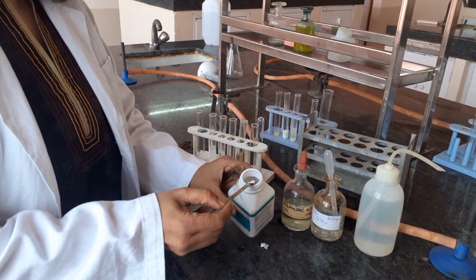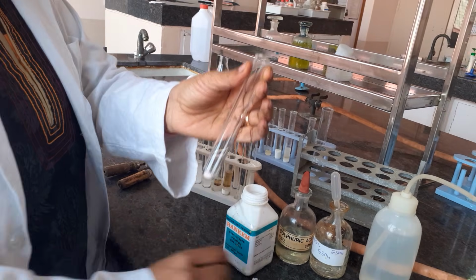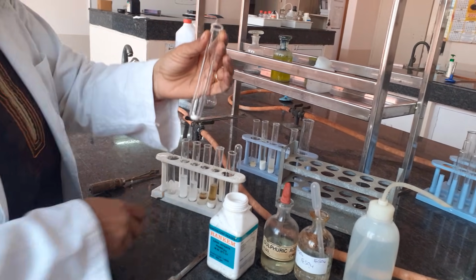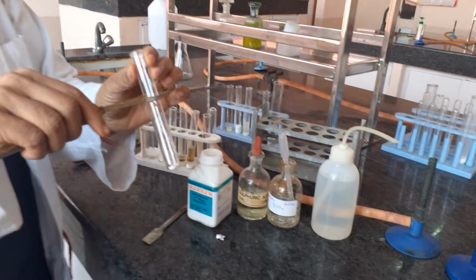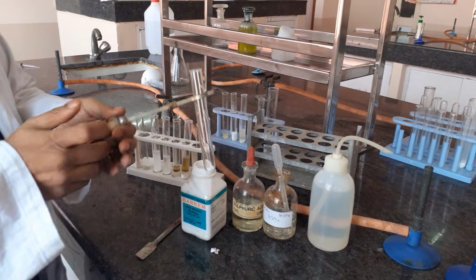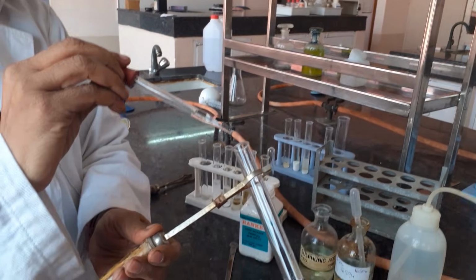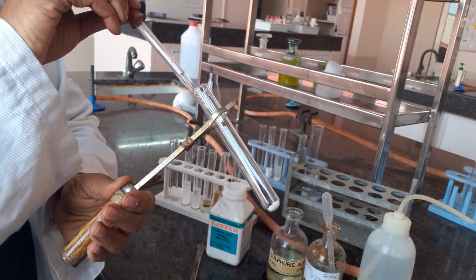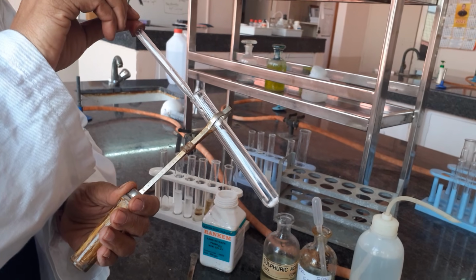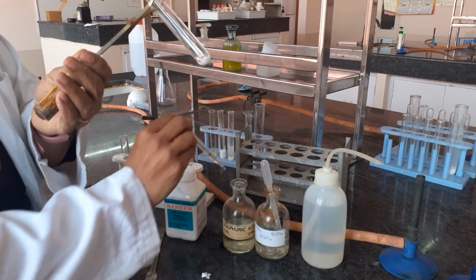As you can see, I am taking a small pinch of my salt in a test tube. To this I will be adding concentrated sulfuric acid. Whenever you add concentrated sulfuric acid, please use a holder because it is corrosive. Your focus should be the test tube. This is my concentrated sulfuric acid and I am adding it to the salt. I will add a little more.